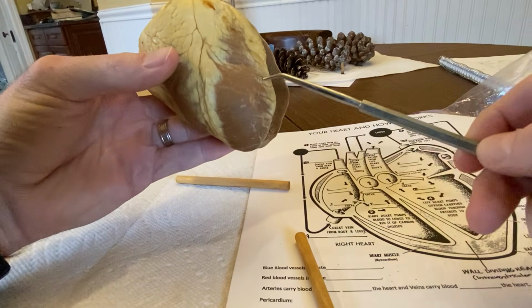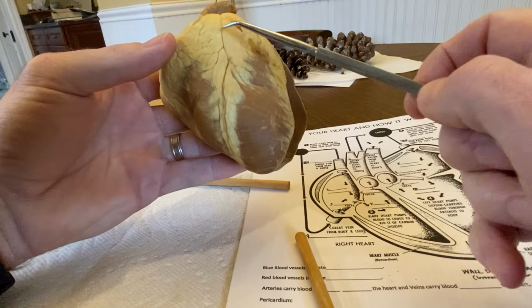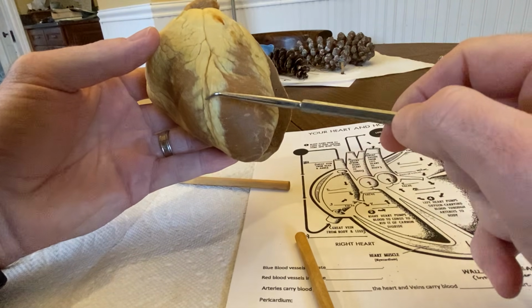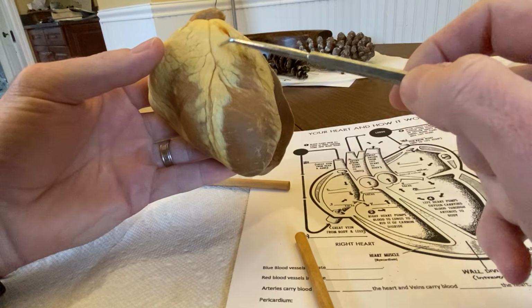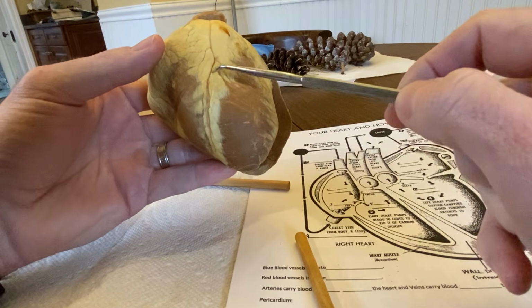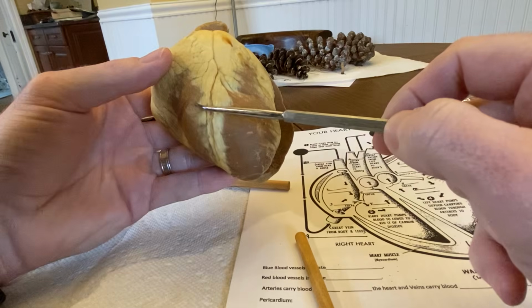Okay, so this is really going to be the left ventricle on this side, and this is going to be the right ventricle, and between these two is the coronary artery, the main coronary. And remember, the coronary artery is the blood vessel that feeds the muscle of the heart, okay? And as LDL, our bad cholesterol, flows through there, it deposits fat all along the blood vessel, okay? So it actually gets marked by a channel of fat more than anything else. You can see the fat, not really the blood vessel, okay? So if you got the coronary artery, then you got left ventricle, right ventricle.